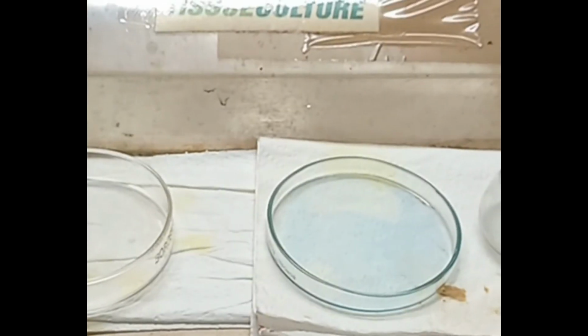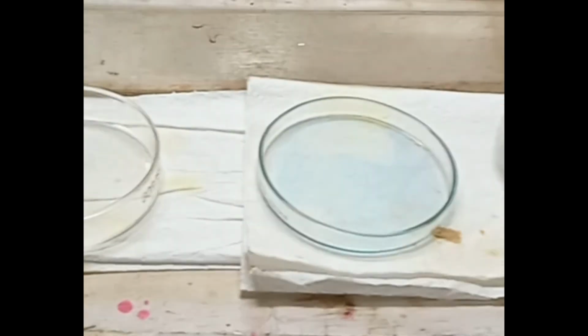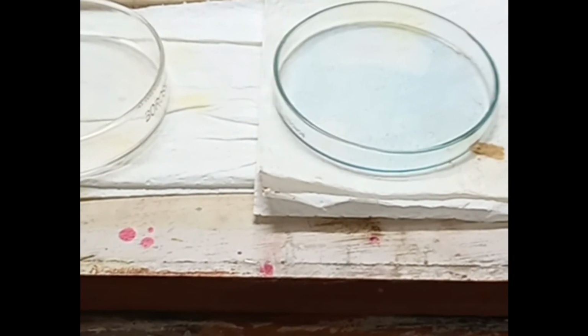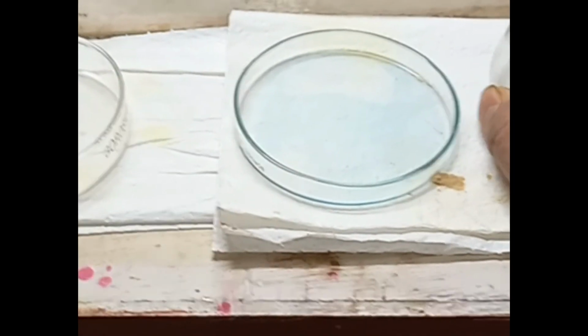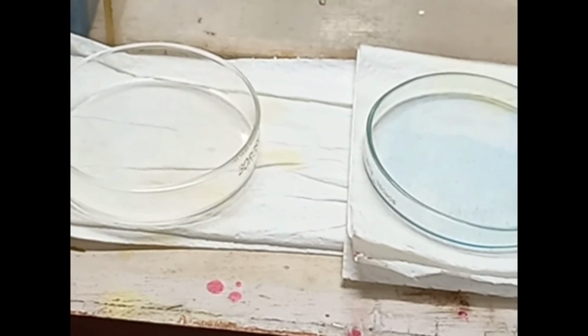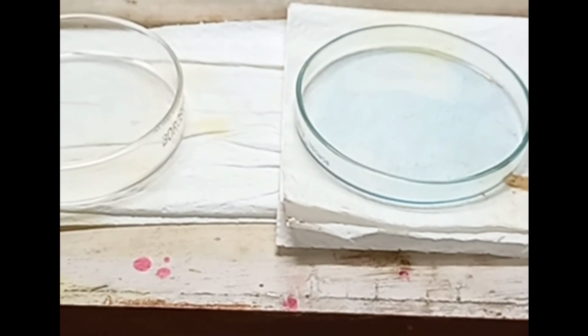These are the basic instruments, the apparatus we need to do microbiological investigation. This is the start point. You have to have this type of apparatus first of all to start the culture media, or to start a fungal culture or a bacterial culture or whatever it is, any microbial culture. You must have this in your lab. This is the actual start point of the microbiological lab.